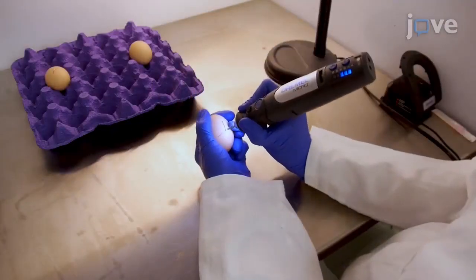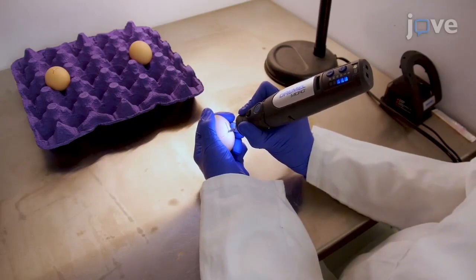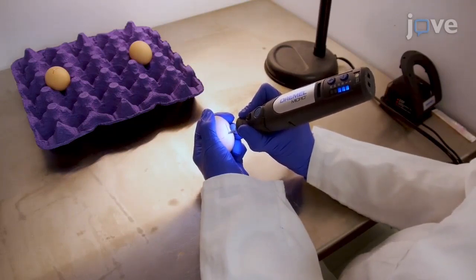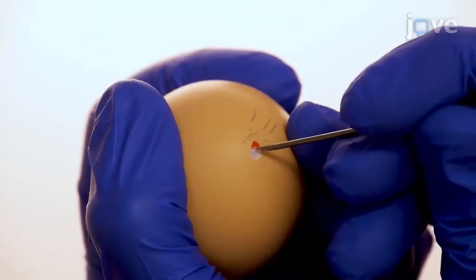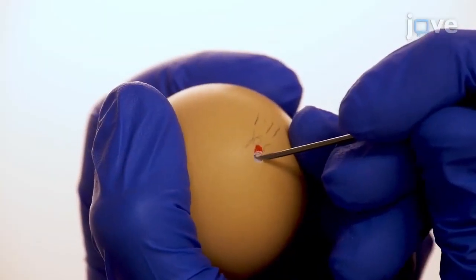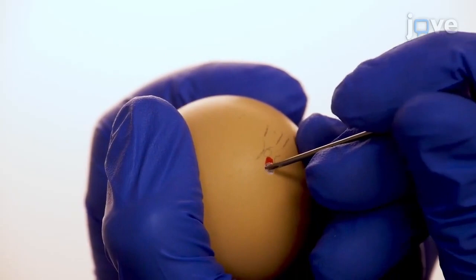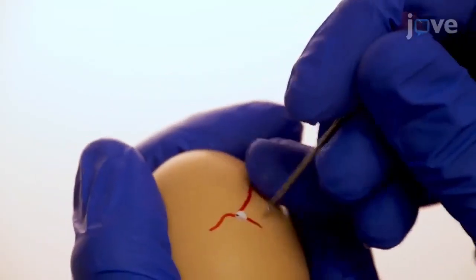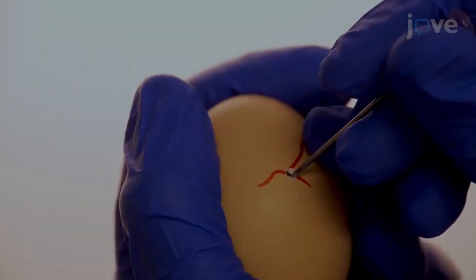When most of the shell has been removed but with the white inner membrane intact, drill another small hole where the vascular window will be opened. When the second hole is ready, use an 18-gauge needle to gently pierce the white inner membrane over the air cell and vasculature, taking care that the white inner membrane but not the CAM is disrupted throughout the entirety of the drill.